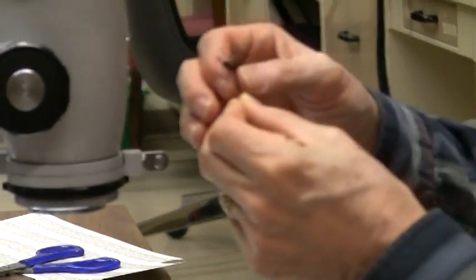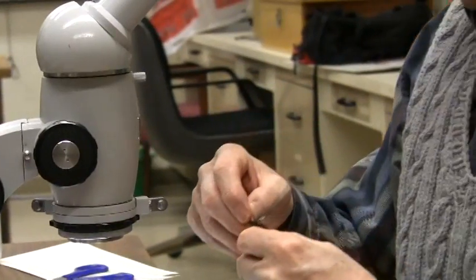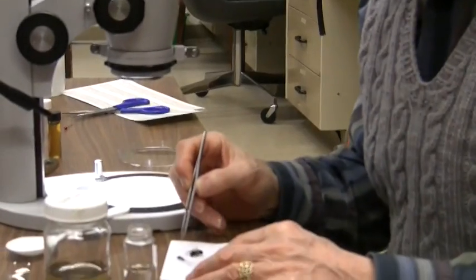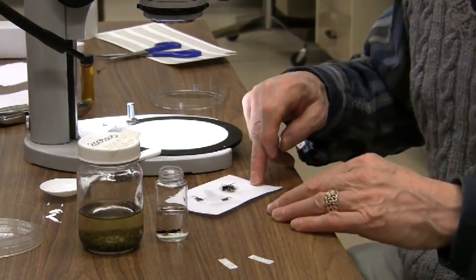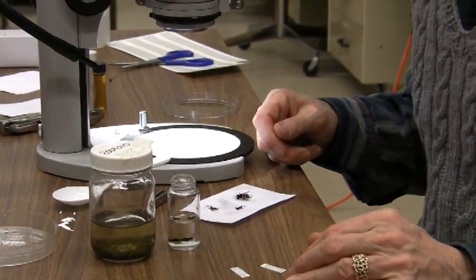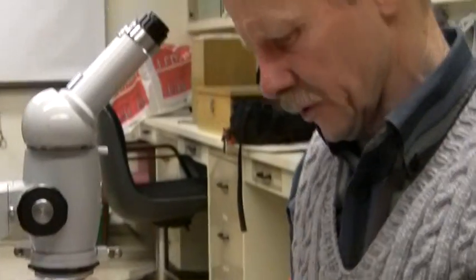Blowing on them tends to keep them looking a bit prettier. So that's what we do with these. This drying technique is something we'll do with pretty much all of the specimens that come out of alcohol — just a standard piece of paper that you lay down to dry the specimens on. Okay, let's take another break and we'll get on to the pointing of the smallest material.